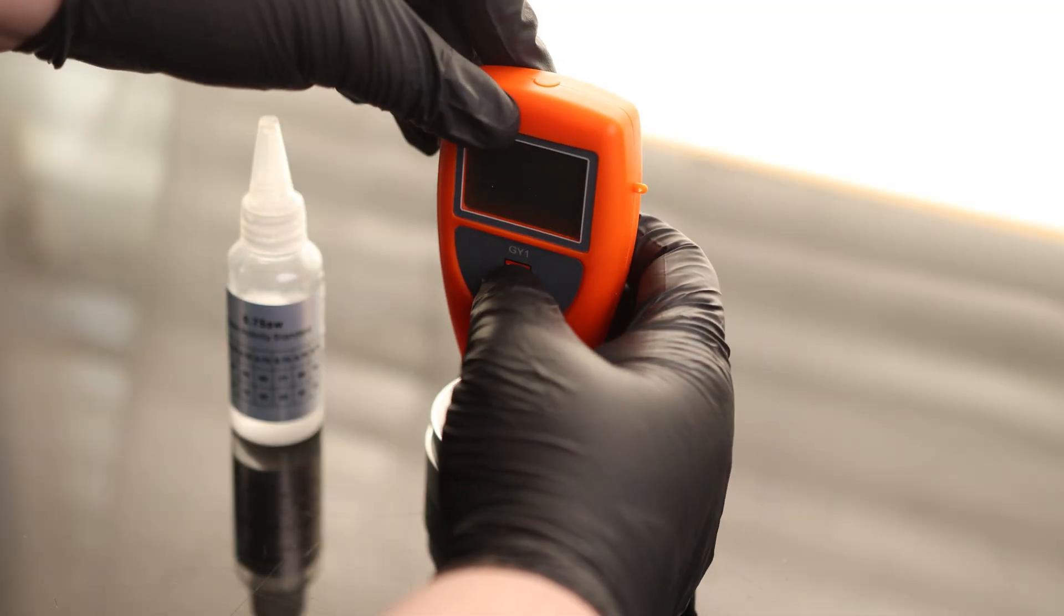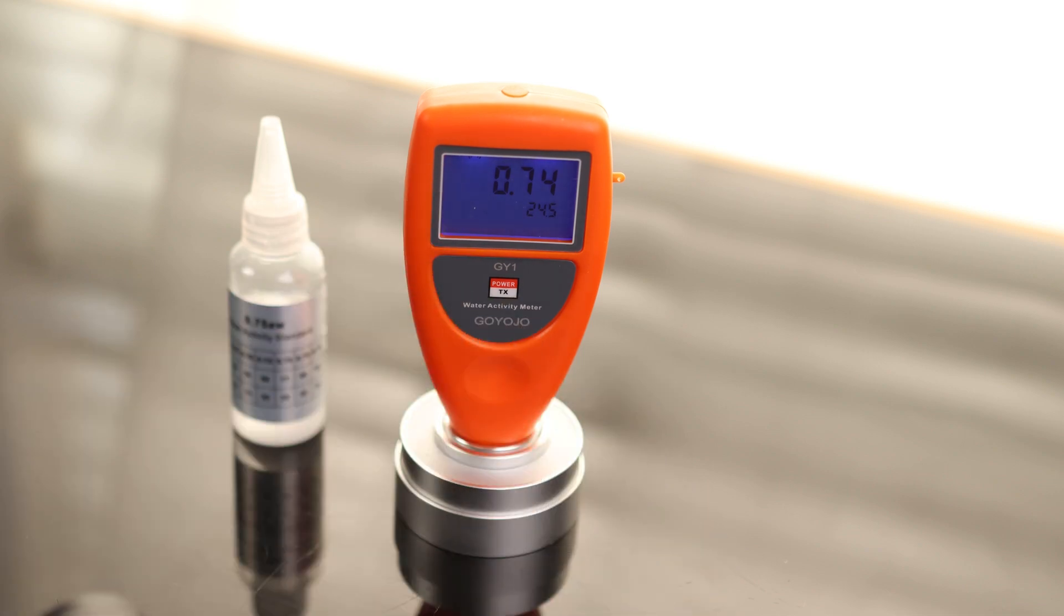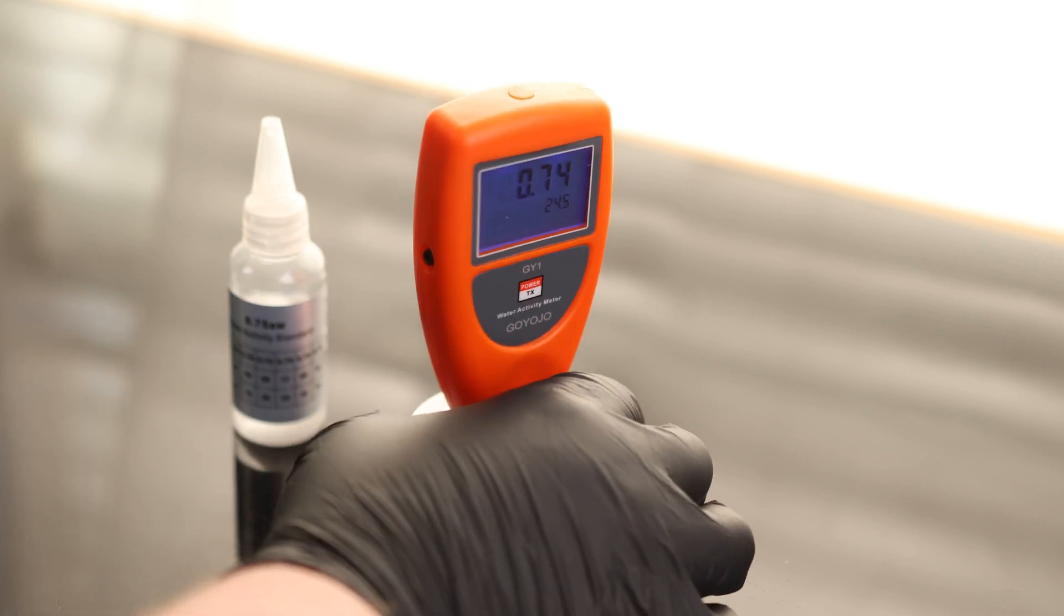It's been about a half hour, so let's see where we are at. We are getting a rating of 0.74, so that is low by 0.01, which is pretty accurate. But let's make it even better.